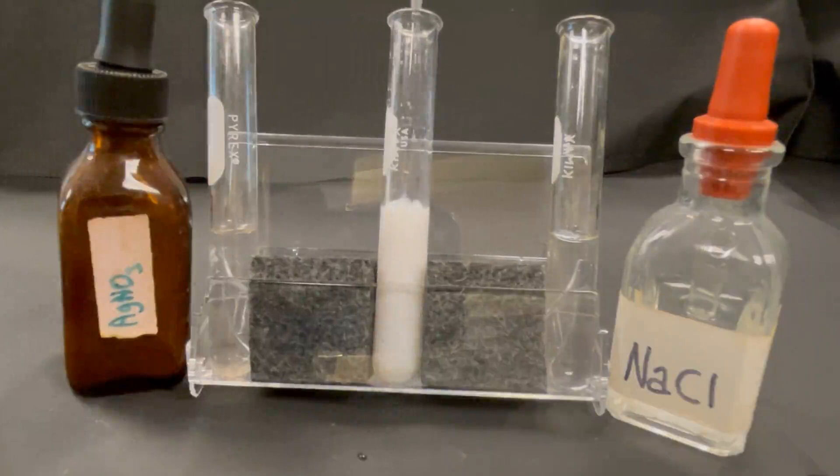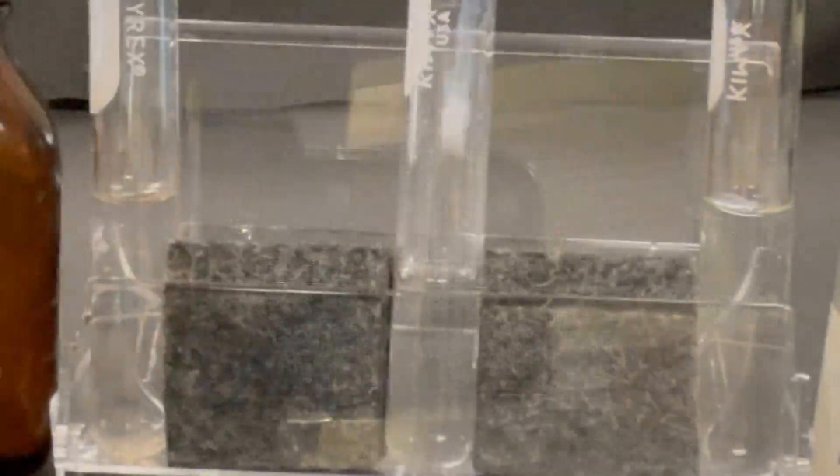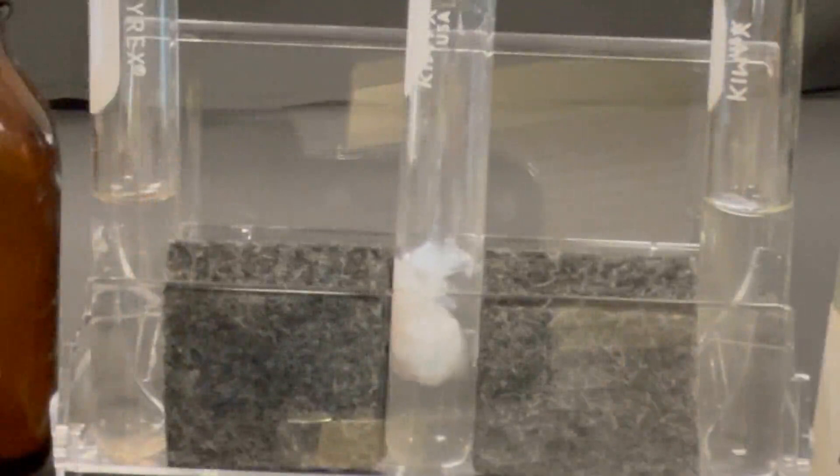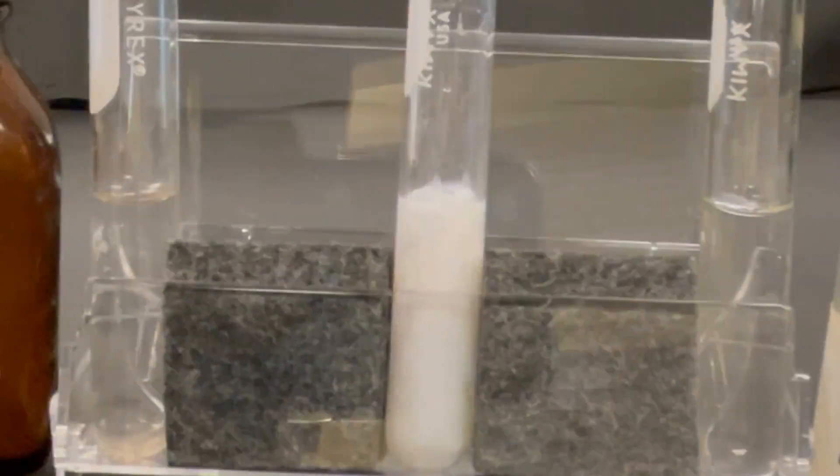So, let's get started. As soon as the two solutions meet, a white precipitate begins to form, giving a cloudy appearance to the test tube.